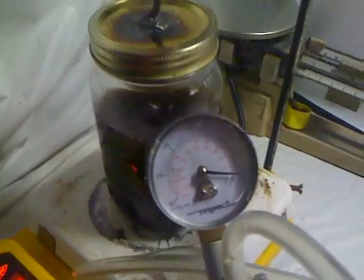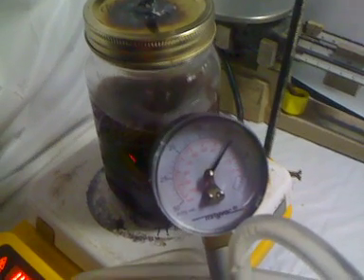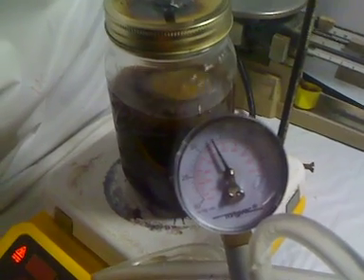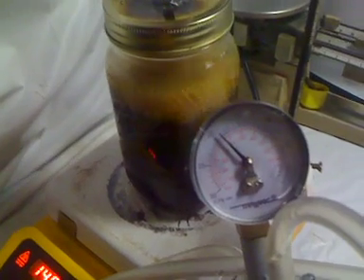There's currently no vacuum on the system. Once we start to introduce a vacuum, you'll see the methanol immediately begin to boil off. Once we reach about 15 to 20 inches of vacuum on the container — we're at 15, 16, 18 — starting to boil.